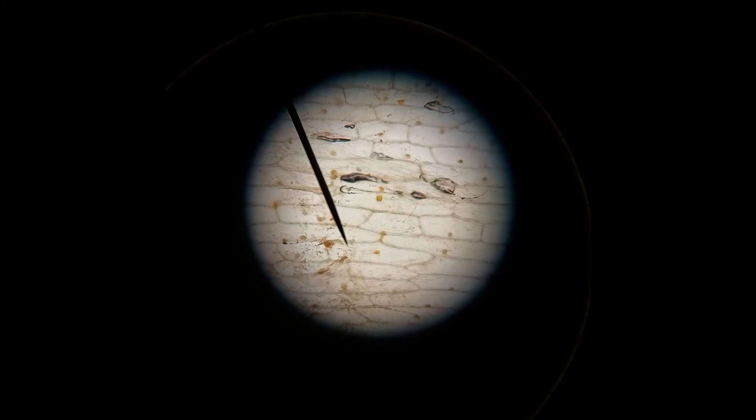I'm going to use the fine adjustment knob to make it clearer. And then I'm going to go in again. To my largest magnification, which is 400 times magnified.